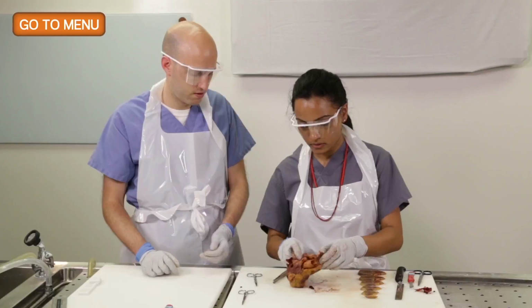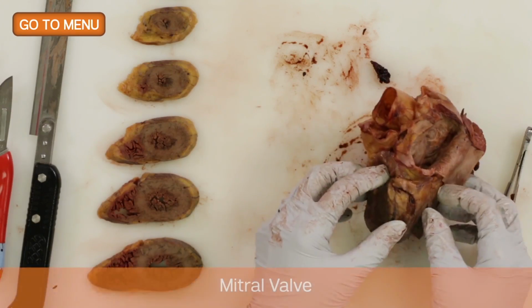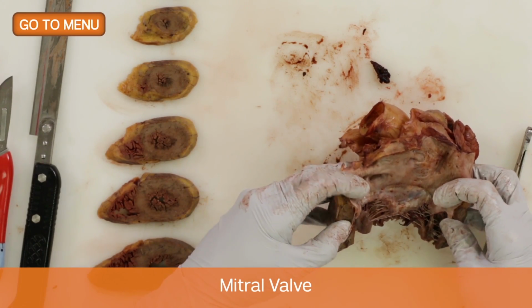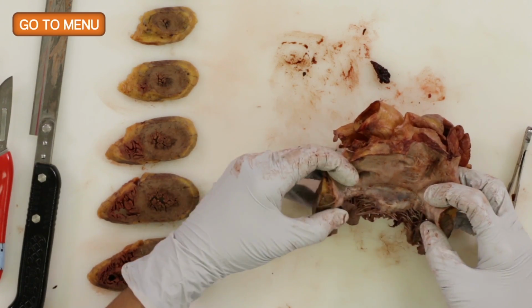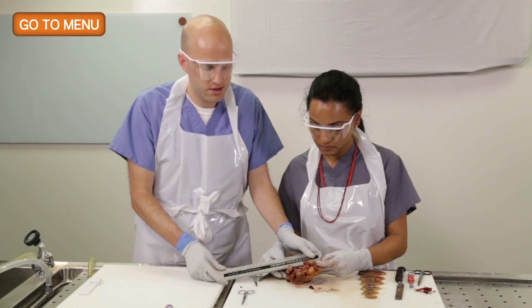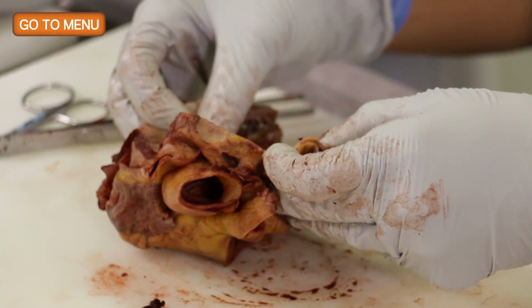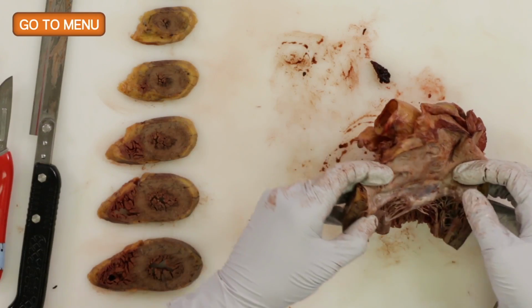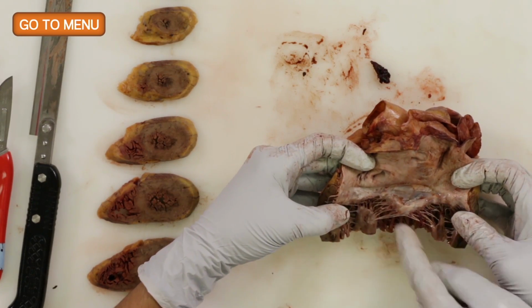Okay. Nice cut. All right, so now we're looking at which valve? So this is the mitral valve. The mitral valve. All right, bicuspid valve. Very good. So we want to measure that. All right, and it's about 9.7 centimeters. Okay. And any abnormalities with the mitral valve? Any vegetations or calcifications? It is a little calcified, yeah. Little calcified.